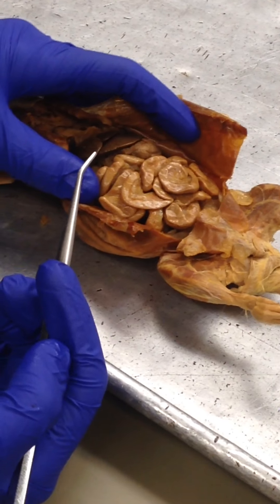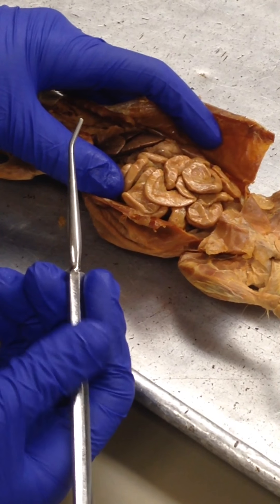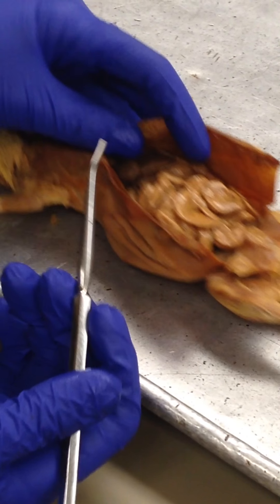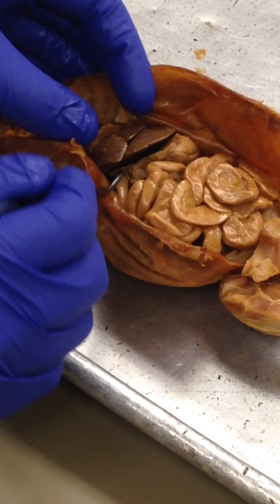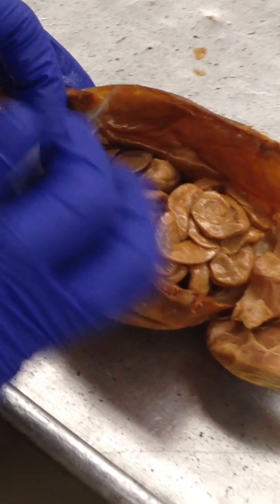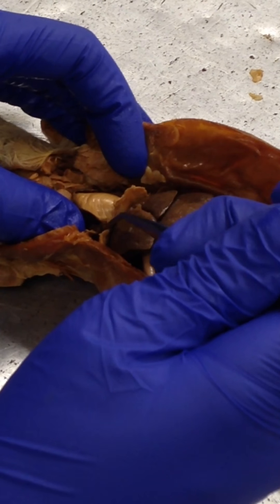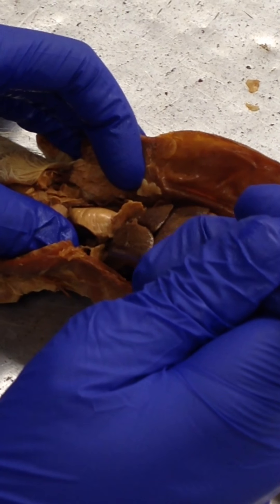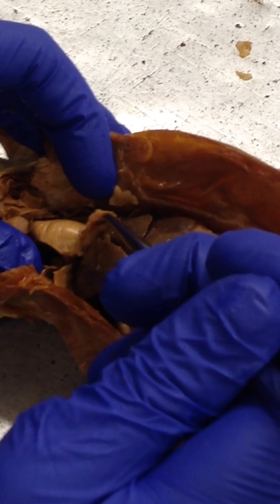So this is the abdominal cavity, and then the diaphragm is going to be these two light brown flaps right above the liver lobes. Can you see it?